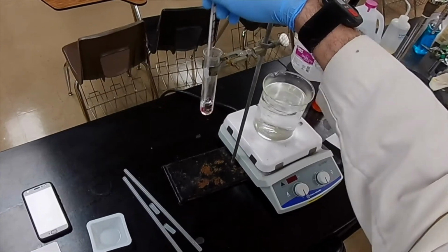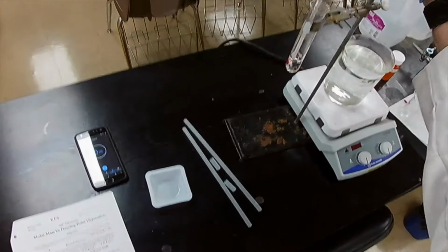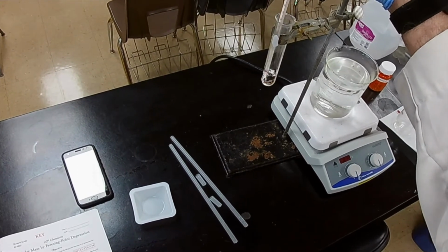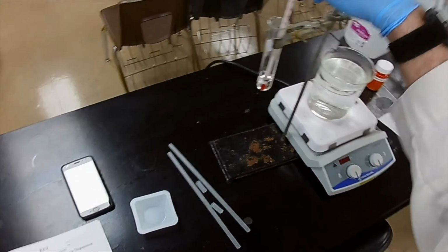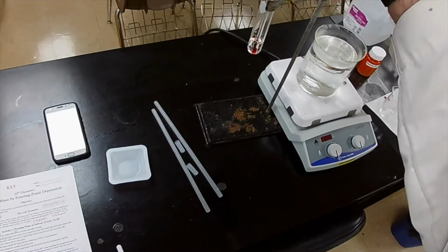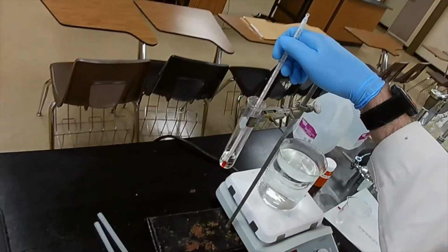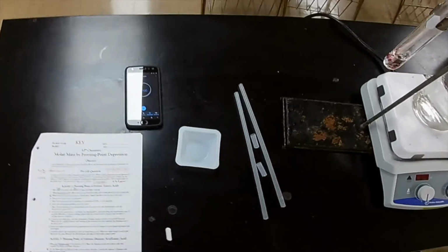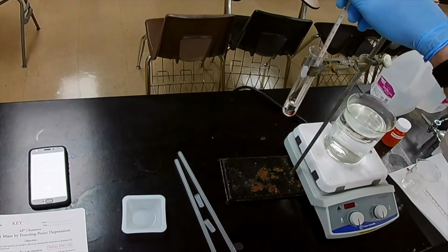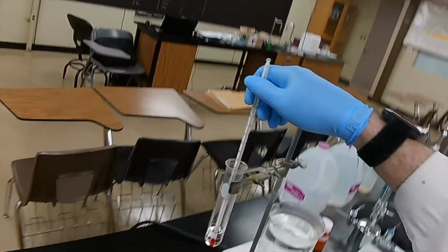We're down to 70. All right, so when it reaches 60, we'll start taking temperatures. Still pretty warm. Yes, indeed. It's on its way down, and we're getting ready to take our first 2 measurements before I write them on the board. Okay. 65.